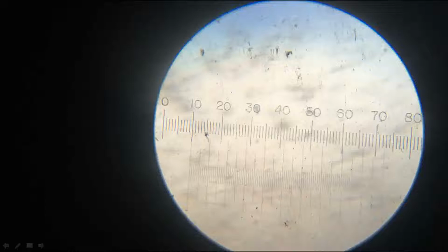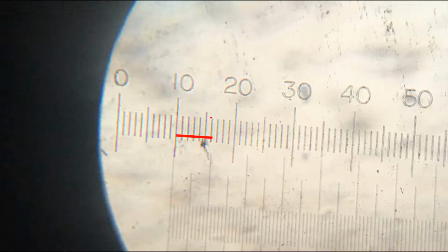Calibration means we need to find the coinciding line, the nearby coinciding line. That's what we require here. In this adjustment, we can see that this line and this marking are coinciding, and similarly, showing you in zoom, this line is coinciding with this line.